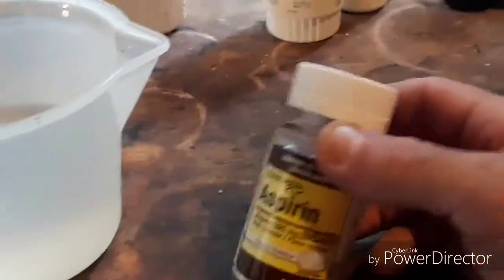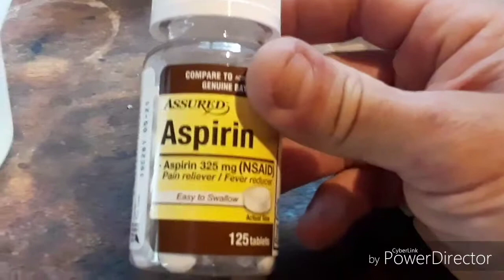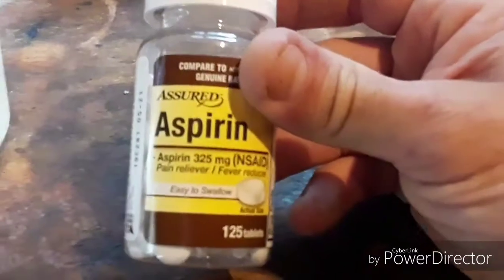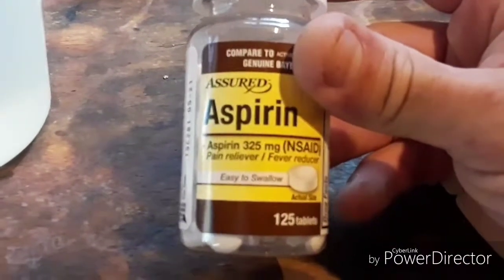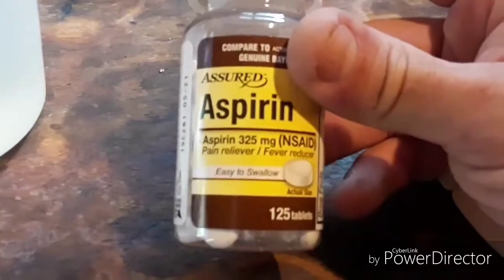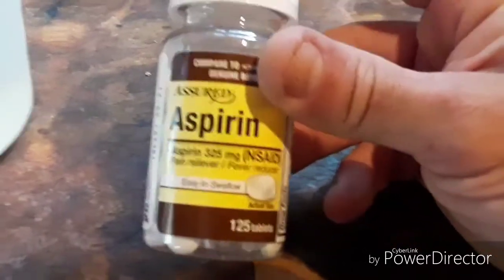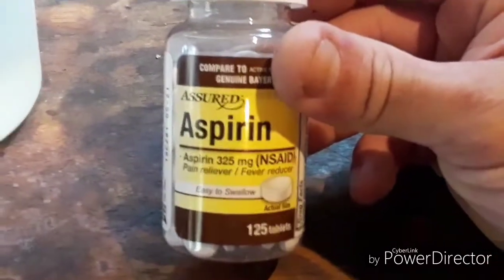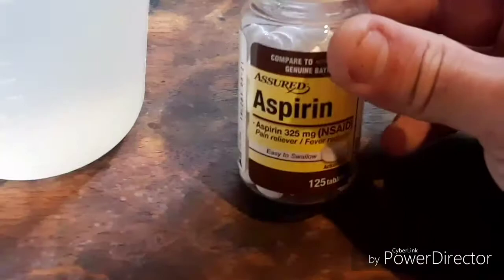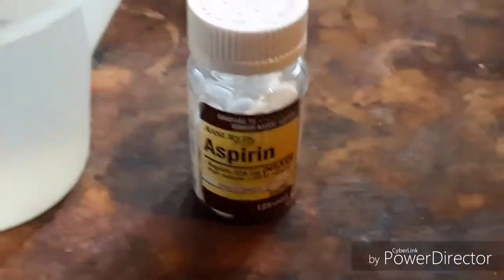We're obtaining ASA from aspirin tablets. I am using Dollar Tree aspirin, because I found it is the best bang for your buck. They are 325 milligrams, and you get 125 tablets for literally one dollar. We only need two things to do this, as far as chemicals go.